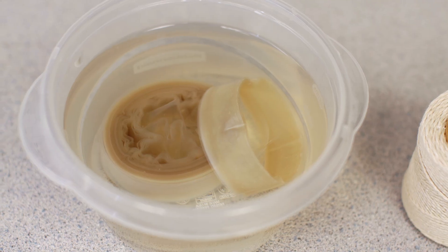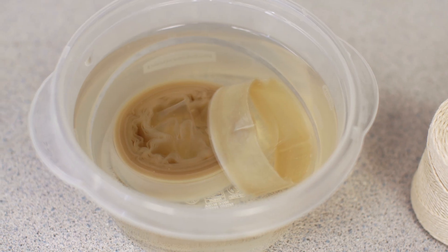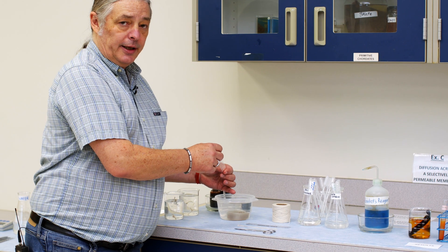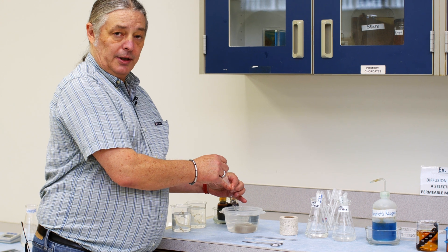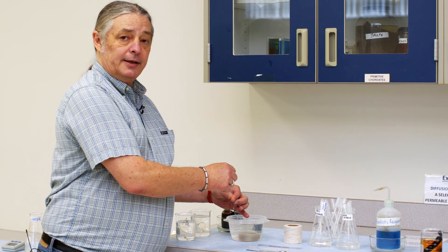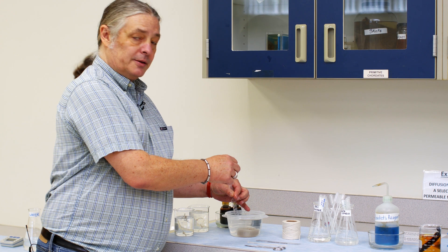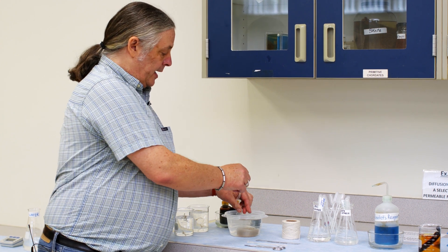So what we have instead is some plastic tubing that will be very similar in characteristics to the cell membrane, in that it is selectively permeable. This is called dialysis tubing, and it will let certain size molecules across the membrane of that tubing and block the passage of others — a similar kind of idea to what a cell membrane does.